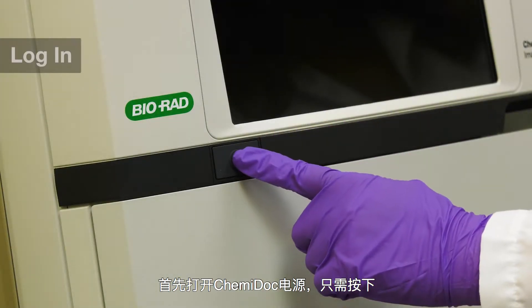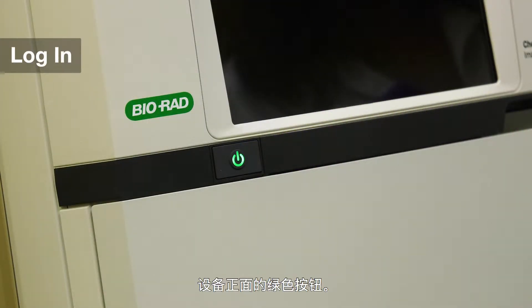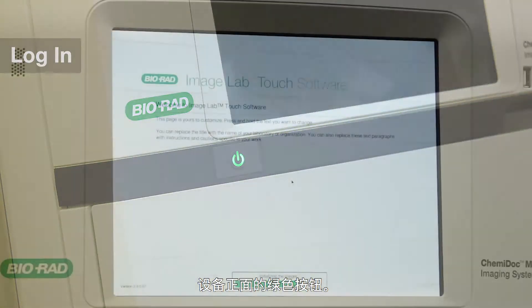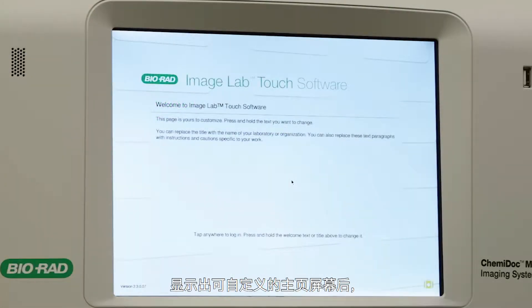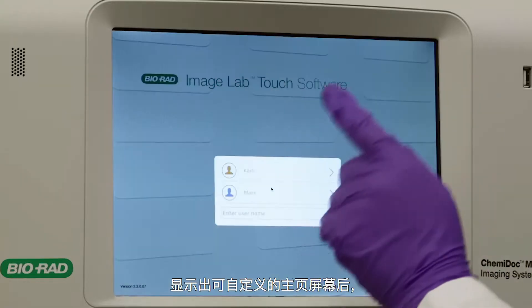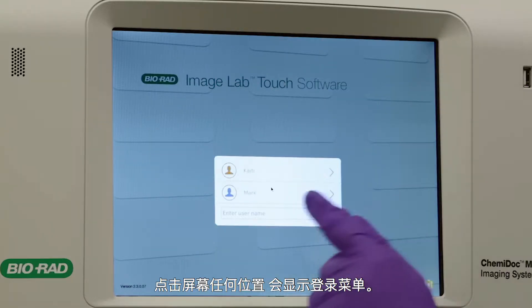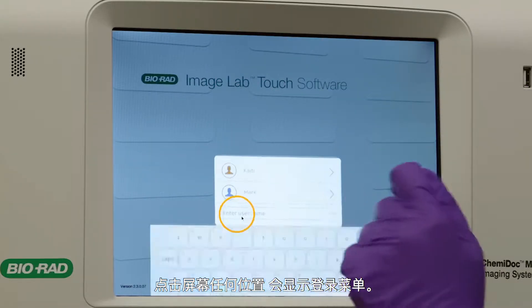To turn on the Chemidoc, simply push the green button in front of the instrument. When the customizable home screen appears, tap anywhere and your login menu will appear.